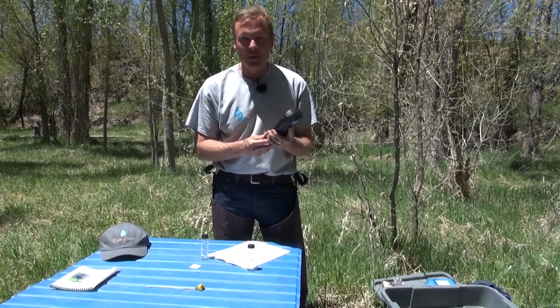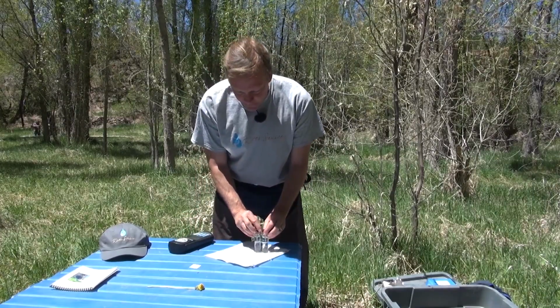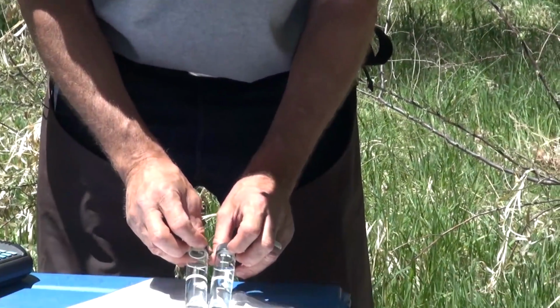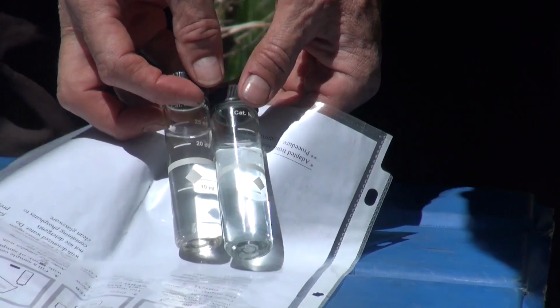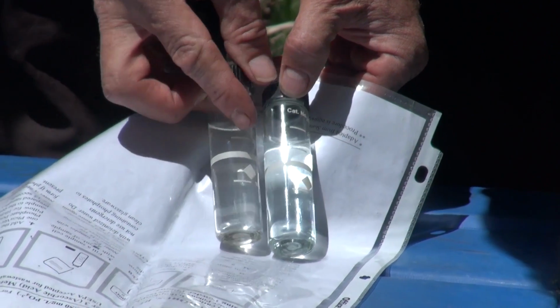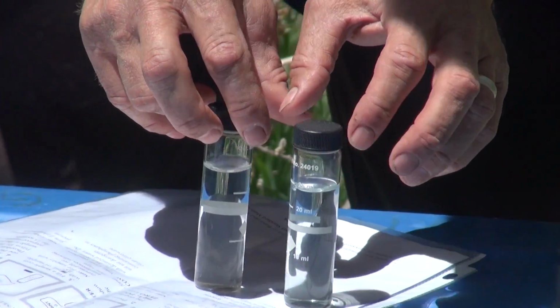Okay, we're almost ready. We've got 26 seconds to wait. Let's just see right now with our eyes if there's a little bit of a difference in color. I am not seeing much of a color difference. Do you? But the machine can read things that are very subtle. Let's put it against a white background. Maybe it looks a little bit bluer right there. All right, 2 seconds, 1 second, and it's beeping.